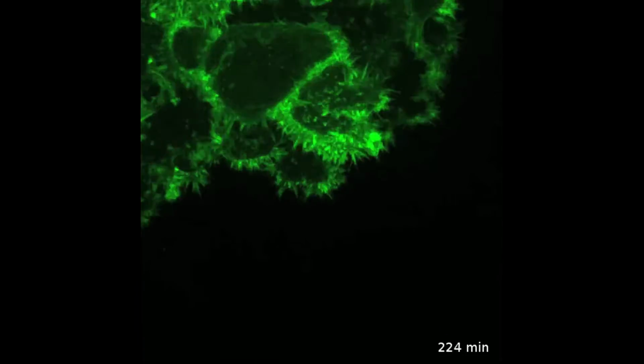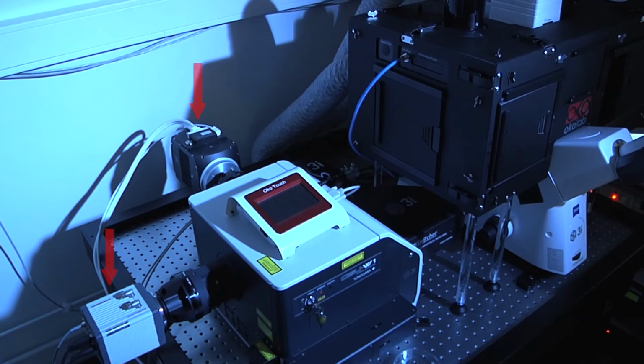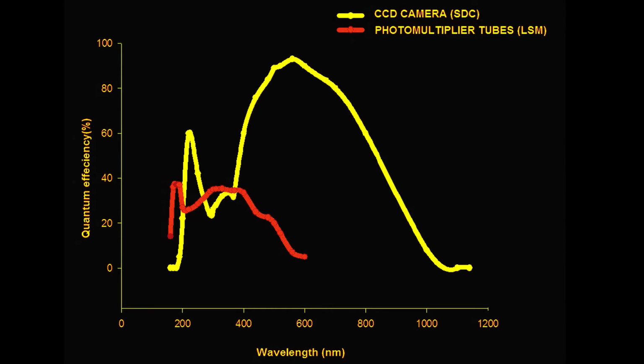With SDC, Guillaume images the migration of cancer cells on cell-derived matrices to study the importance of protrusions for the invasive properties of cells. Apart from the scanning unit, the detection of signals by cameras plays a major role in the productivity of the SDC system. It is based on CCD cameras, which have better quantum efficiency than photomultiplier tubes used in LSM.